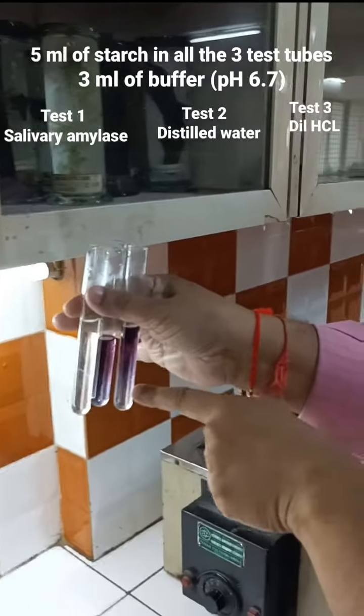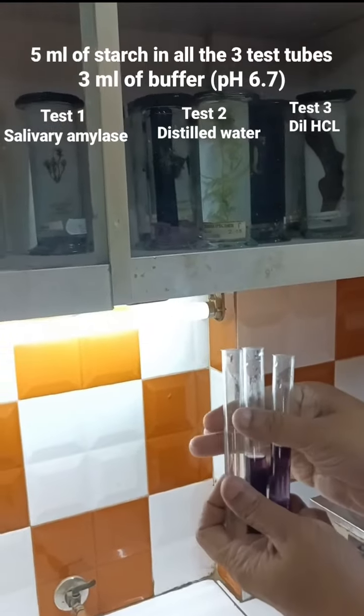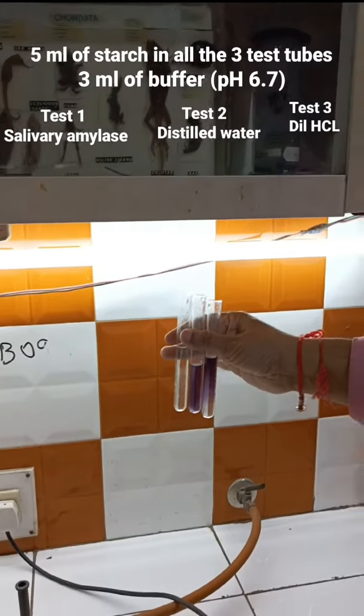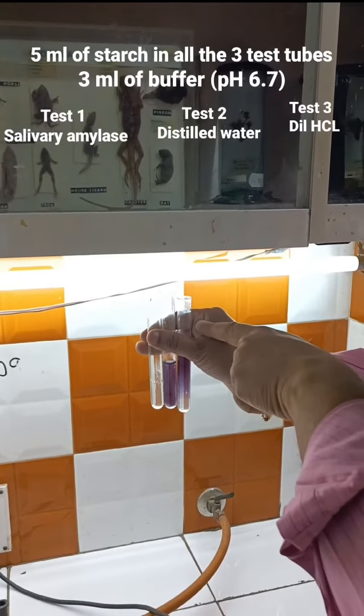So salivary amylase acts on starch, breaks starch into disaccharide, and you will not get blue color in test tube number 1. So this is all about the action of salivary amylase on starch.